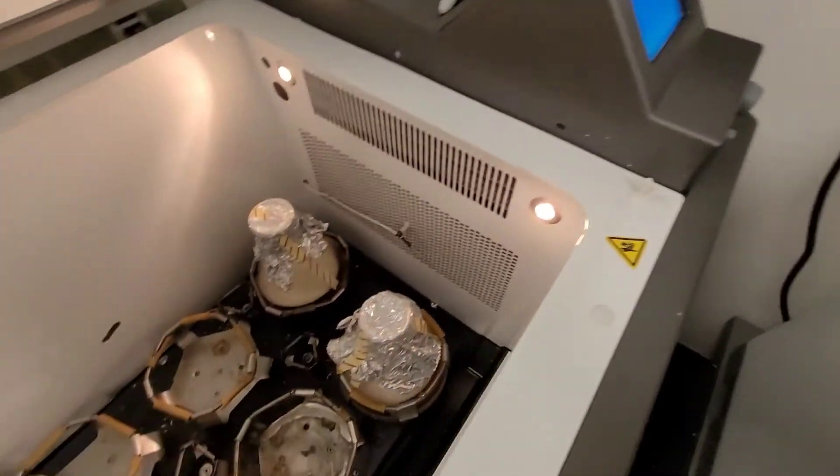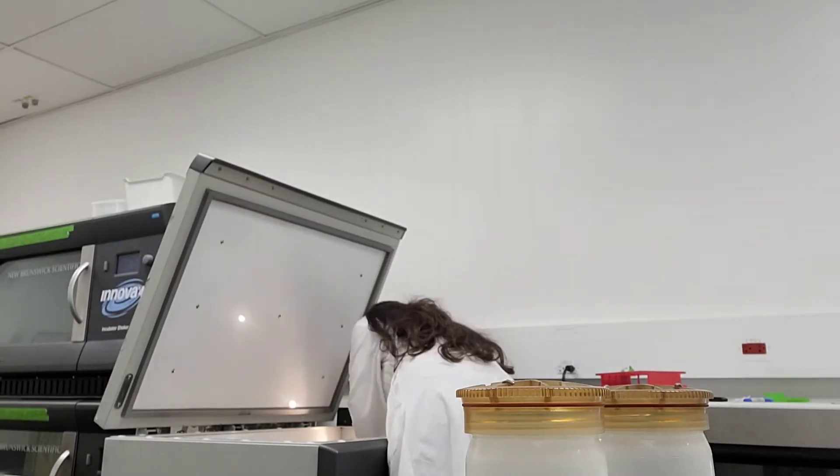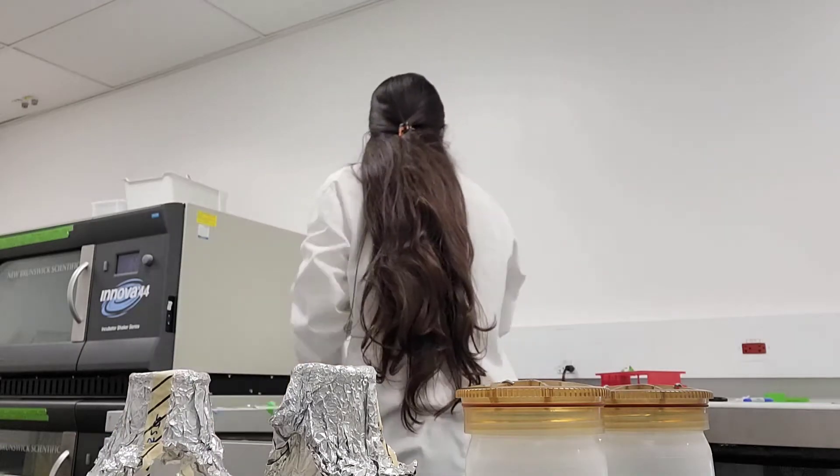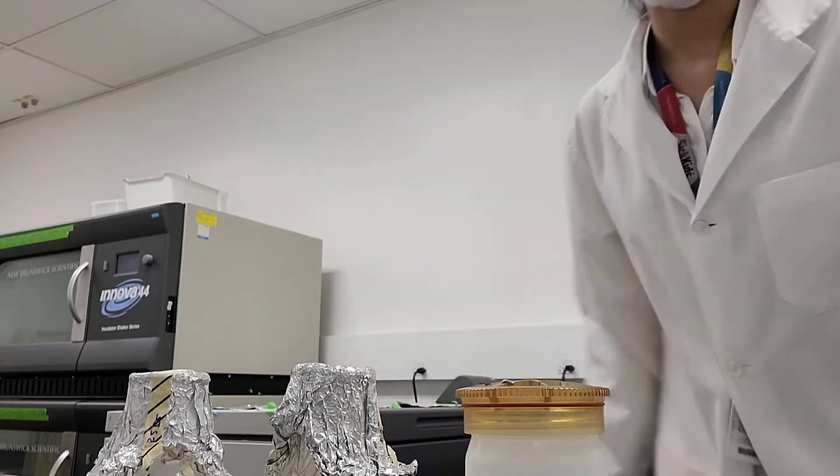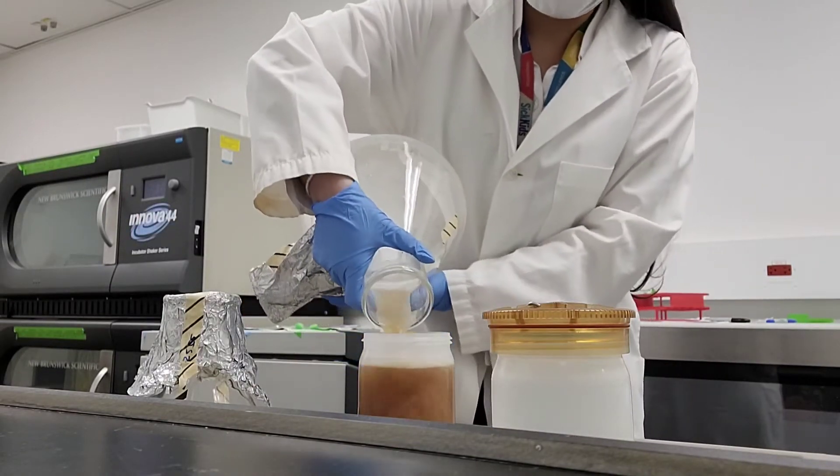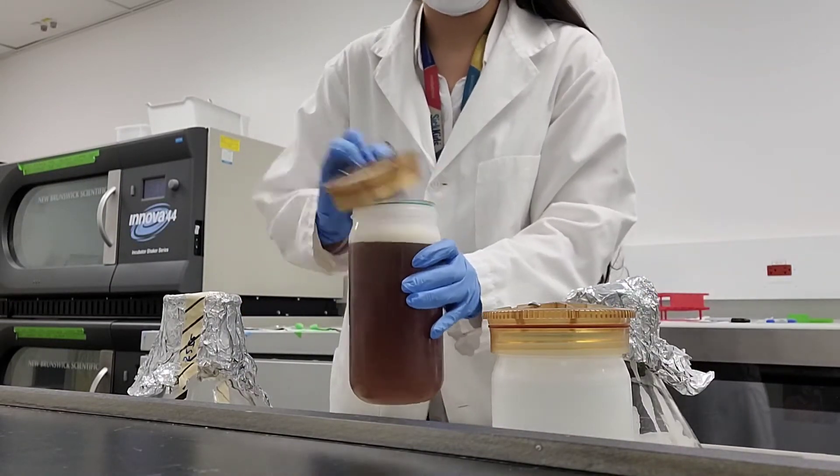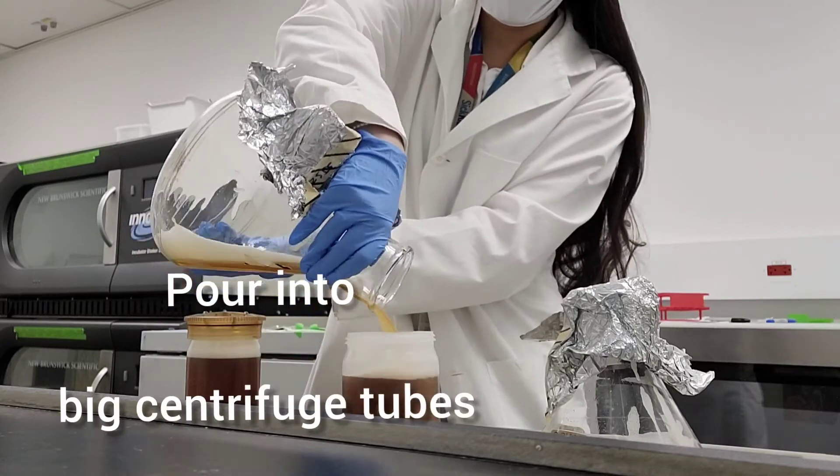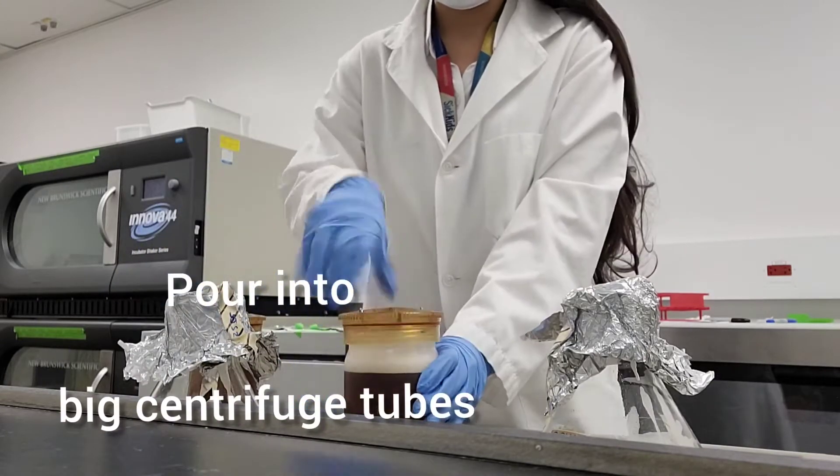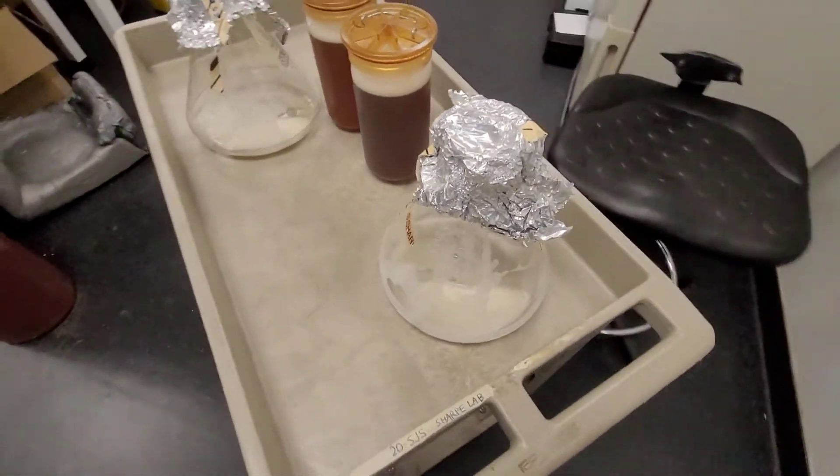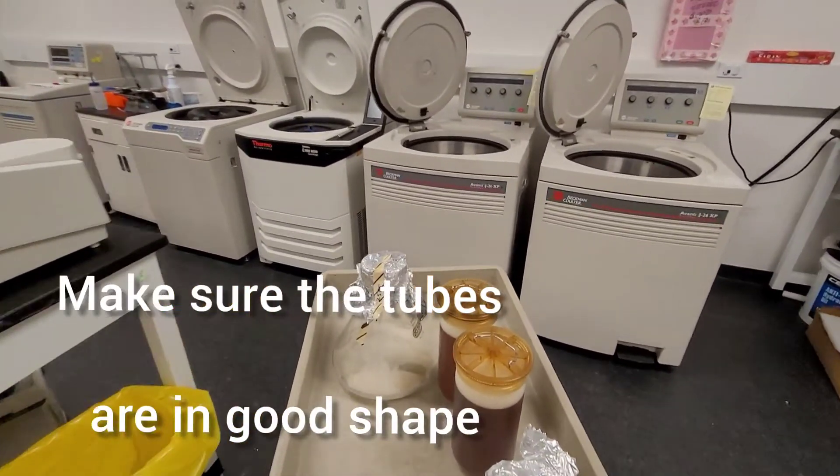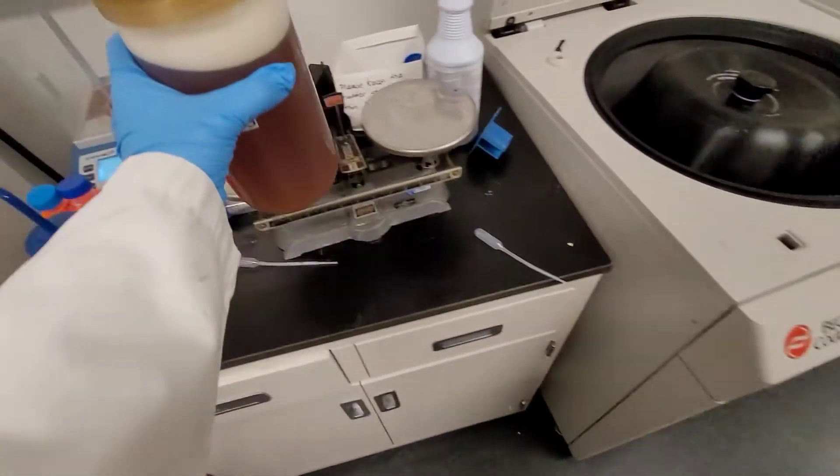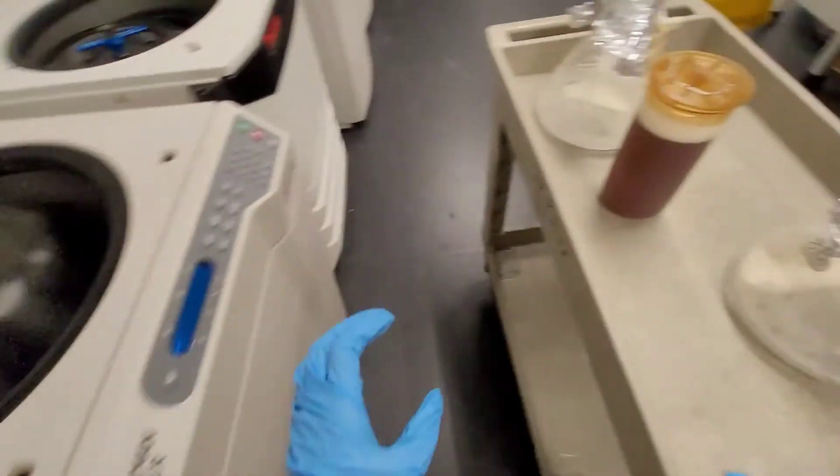Three hours have passed and I'm back. This is why you should start in the morning or early in the day because it will take about five hours to do this in total. Next, you want to pour it in these centrifuge bottles. These are really strong, so make sure that they don't have any cracks or anything in the bottom because you don't want them to break on you and get bacteria all over the centrifuge. Make sure they are in good shape.